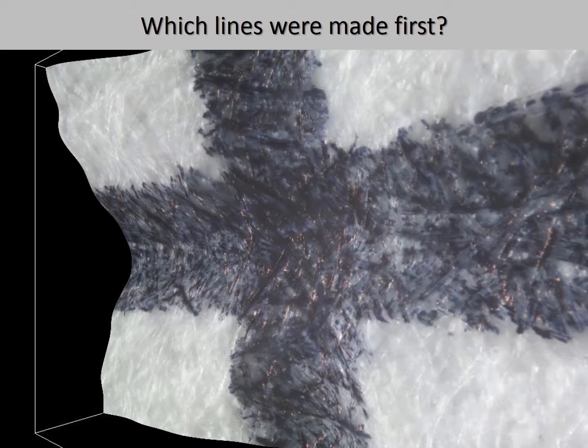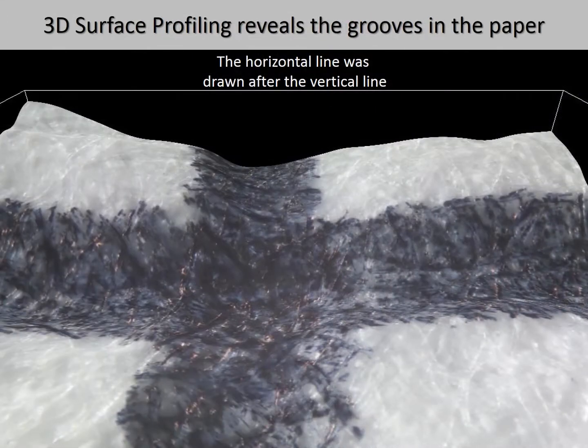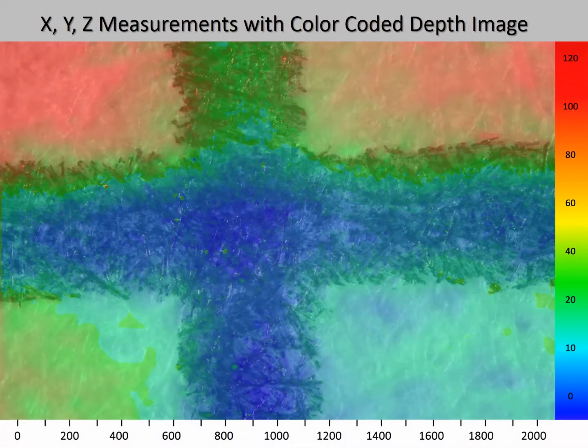The 3D model indicates that the horizontal line was drawn after the vertical line. The addition of the color-coded depth image verifies that this is true. We see this because the horizontal line created the continuous groove, whereas the groove in the vertical line was interrupted by the horizontal line. This positively confirms that the horizontal line was drawn after the vertical line.